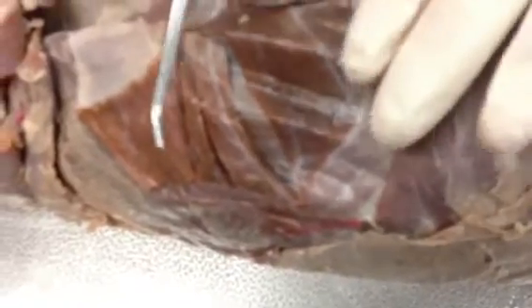Then underneath there is the parietal peritoneum, and we'll see that a few lectures from now. The parietal peritoneum lines the abdominal cavity, and the peritoneum that lines the actual organs inside is the visceral peritoneum, but this is the parietal peritoneum. And then in between the parietal peritoneum and the muscles is the internal fascia, and you can't really see it, but just know that it's there in between them.